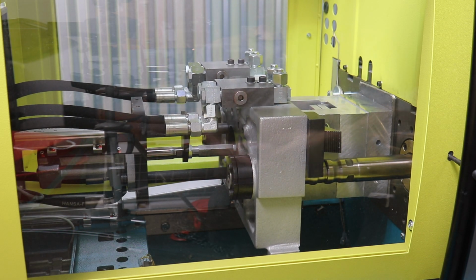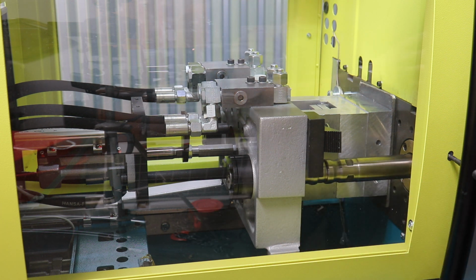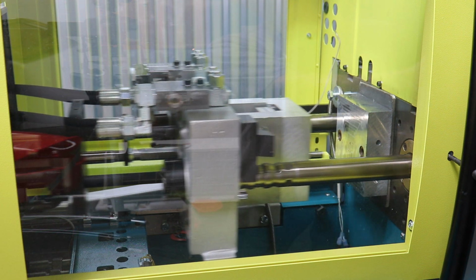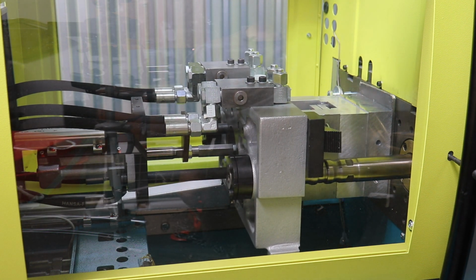And it does. So I think basically the mold grew when it heated up, and the molding machine was able to sense that the mold is bigger now than it should be, so it stopped. It didn't allow it to clamp up until I taught the new hot mold height. So this machine is actually pretty accurate on measuring distance. All right, so let's try shooting our first part now. And that's the auger moving forward, and then we're injecting and we went to zero, so we did a full shot. So we may have to add more plastic.